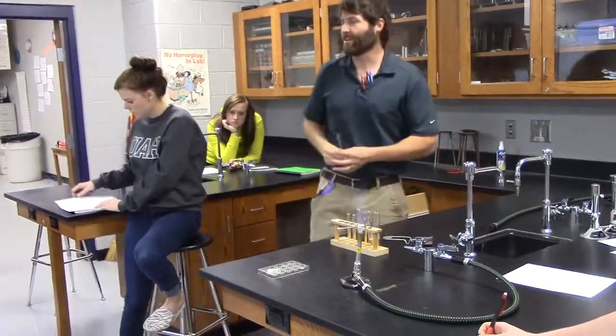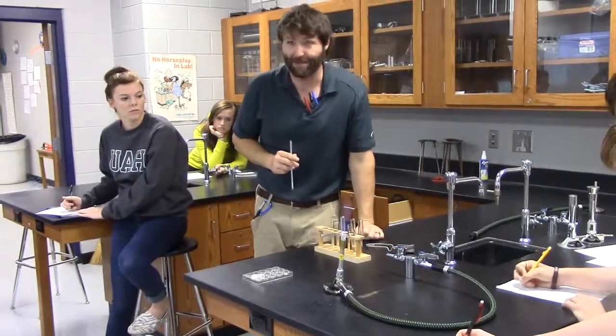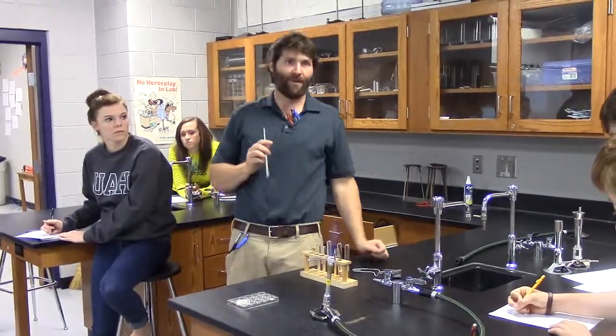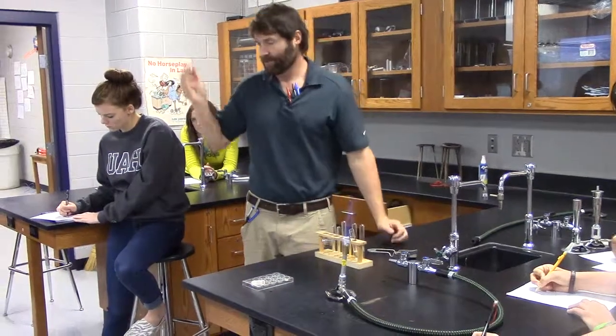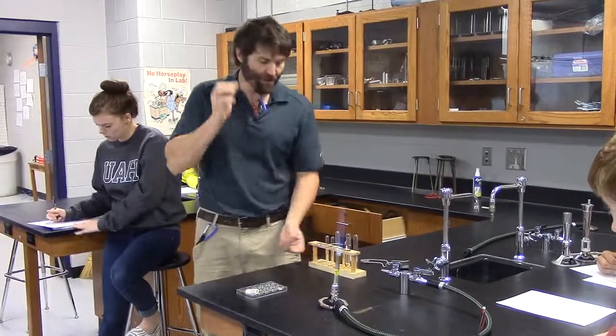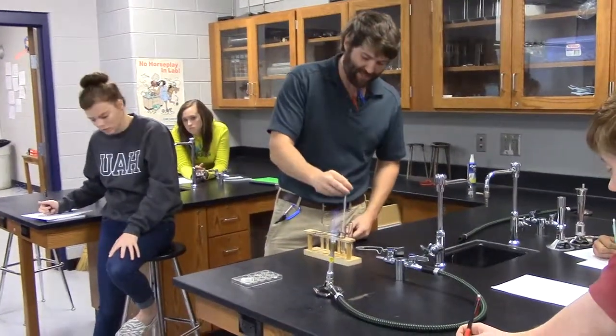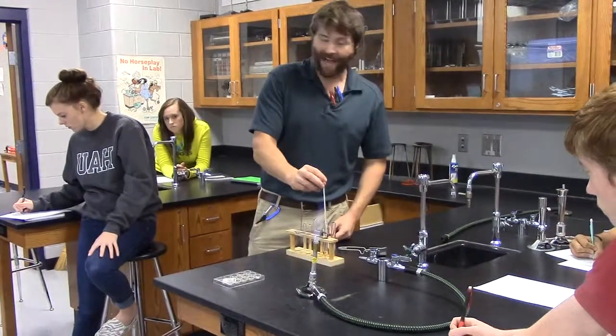Step number 3, clean. Now you're going to have to make sure and tell someone how to clean. I'm just going to say clean the loop for my step 3. You need to have more words in yours than that. But step 3, clean the loop. So how do we clean the loop? We clean the loop by dipping it in the HCl. So notice this. This is how you clean the loop. You dip it in the acid and then take a while.